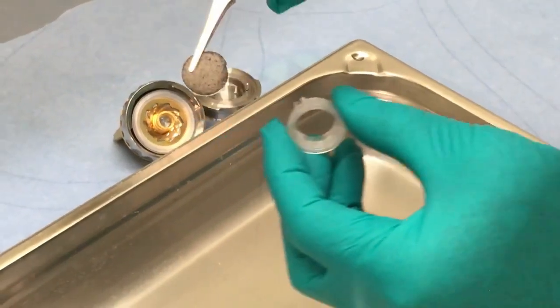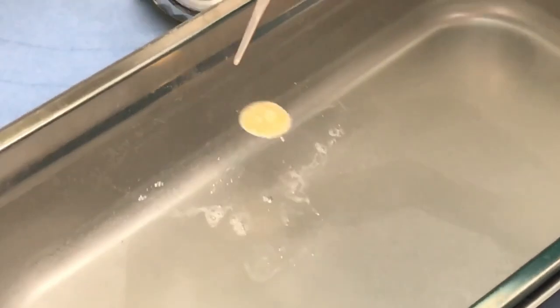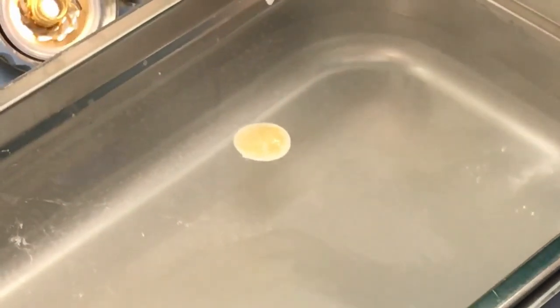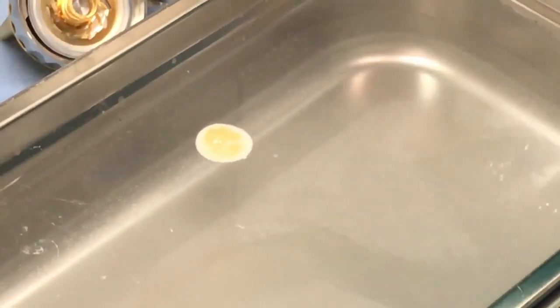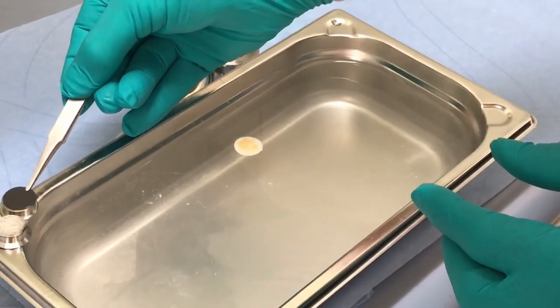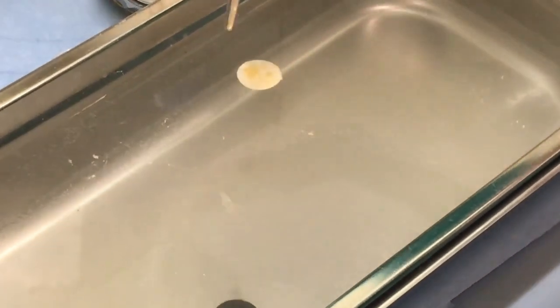But this separator with the lithium dendrites inside is very reactive. You also see the brownish color of the electrolyte due to degradation of the electrolyte and reacting with the lithium metal.